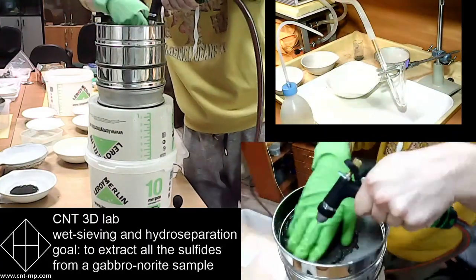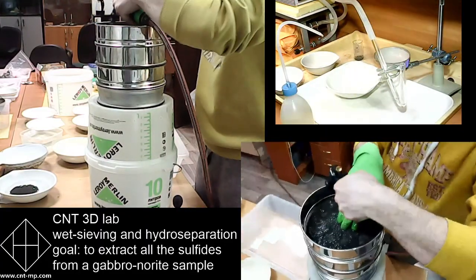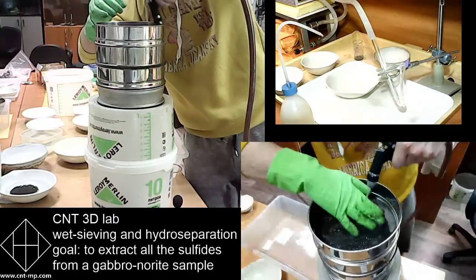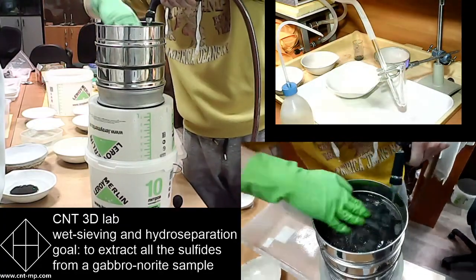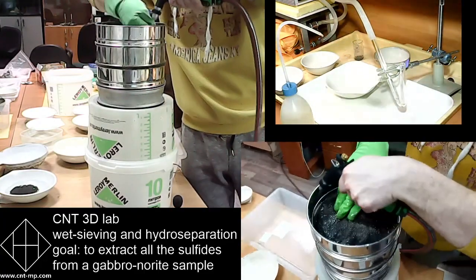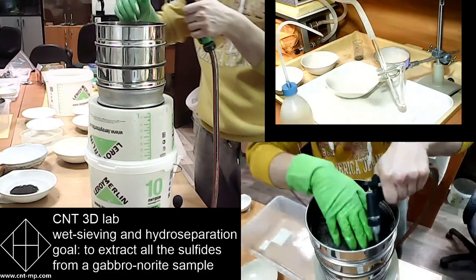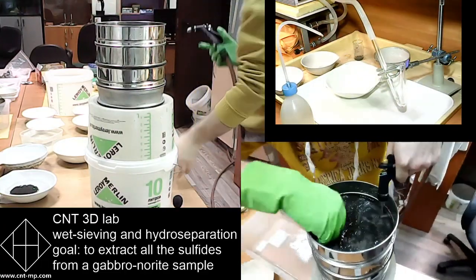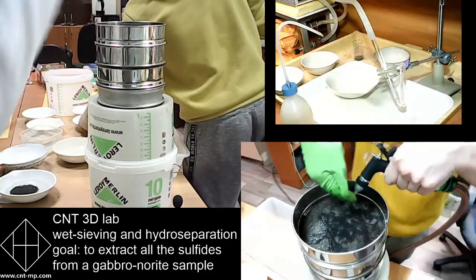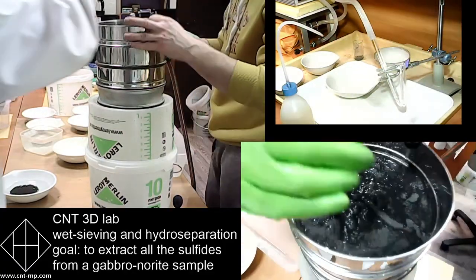So you can imagine that with automation, it won't be so accurate. This one's like you do not spill even one drop. And now he does it by hand, manually, just grabbing the first sieve. It's very important to see everything to make sure that you guys are able to do it on your own.